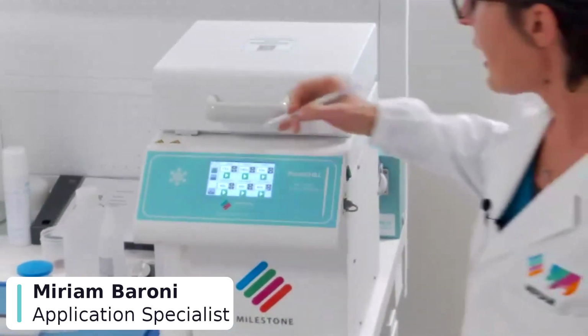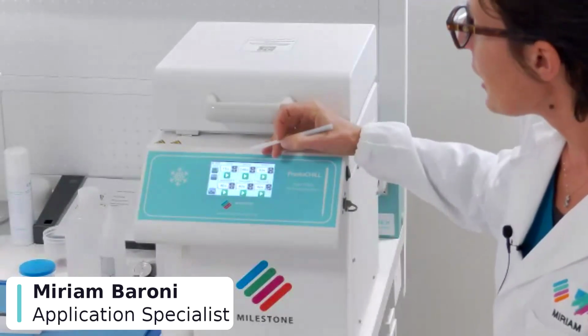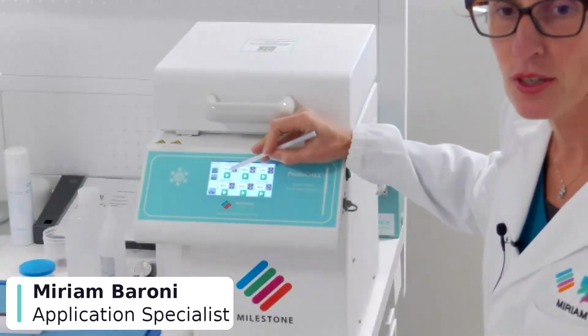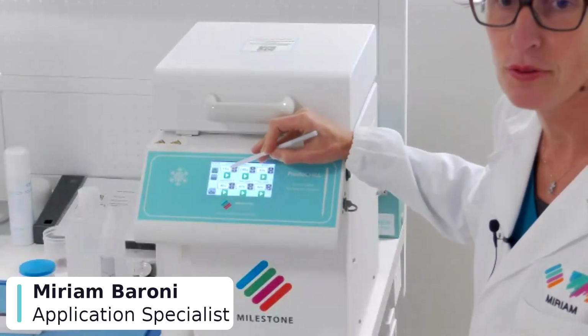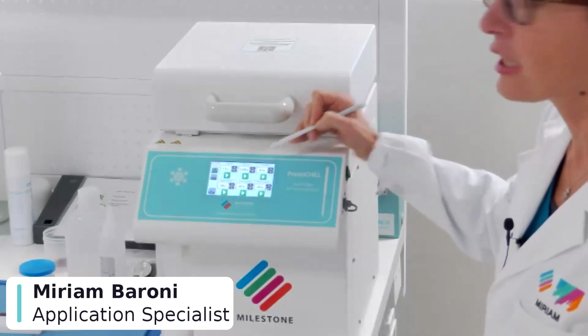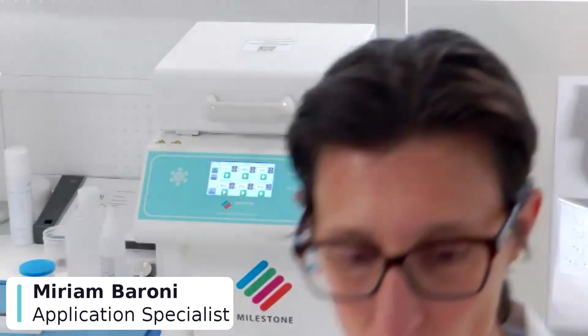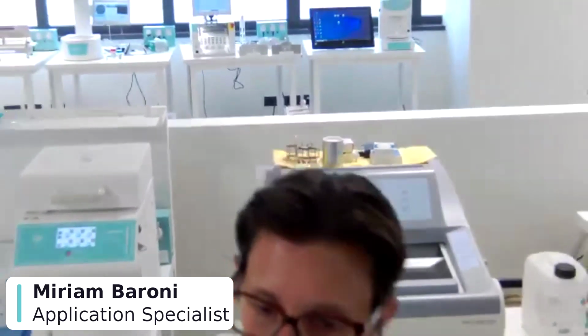Oh, maybe now. Okay, so we have this page in which we have 6 different timers, and we can set up the name and the perfect freezing time for each tissue type. So for example, here in my lab for brain, I freeze only 15 seconds. For breast, I do 240 seconds, so 4 minutes, and for kidney, 30 seconds. Anyway, the best way to see the result of the PrestoChill is to organize a demo, so you can test with your own samples and see the result with the different tissues.